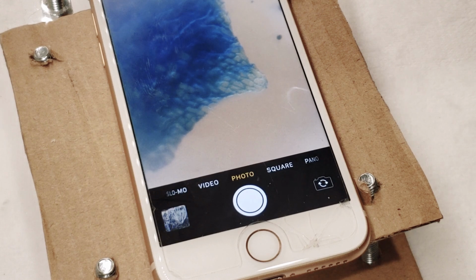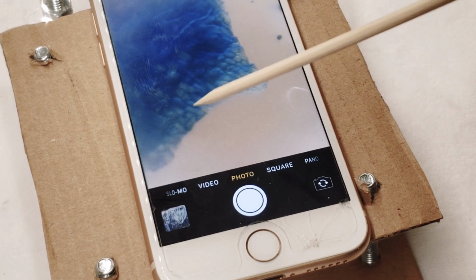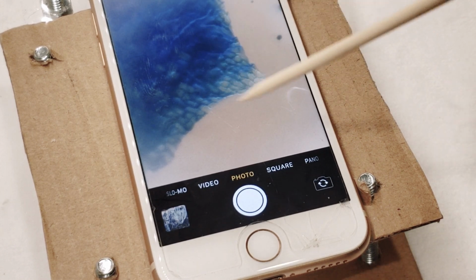Magnification. Oh, look at that. You can really see the cells right there. So you can see right in this area, it's really well defined.